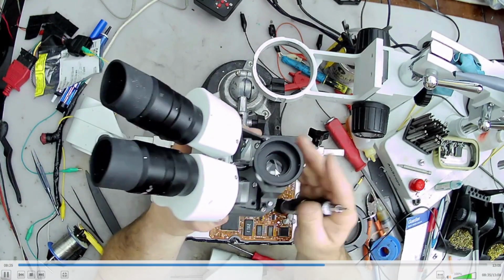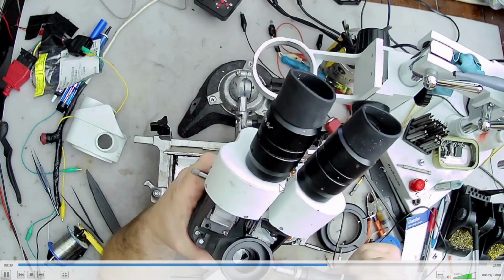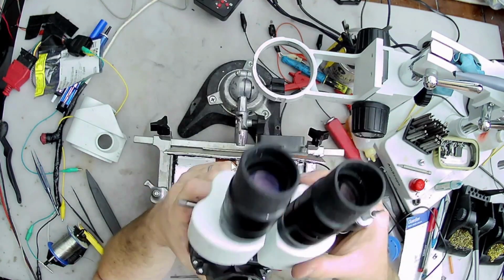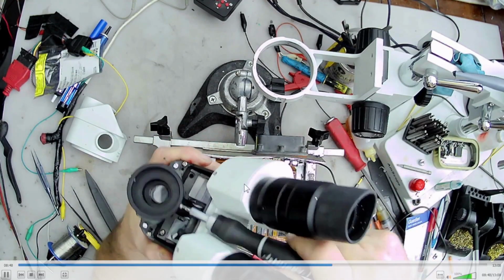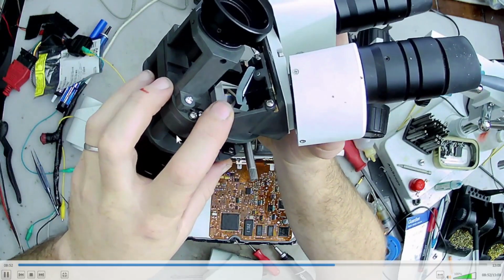And I try to get the back one, but the way it's positioned, it's really difficult to get it from straight in. Maybe if you have like a 90 degree Allen wrench, you could do it, but I didn't particularly have one, and I think 3 out of 4 is probably plenty enough. And like I said, it's very simple.